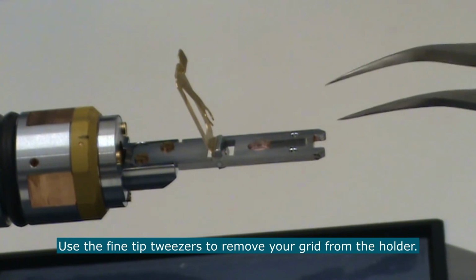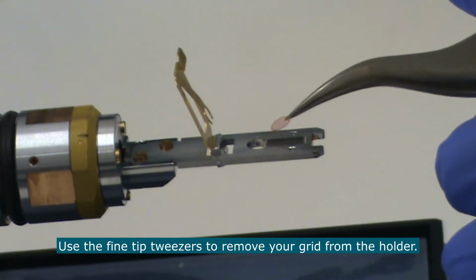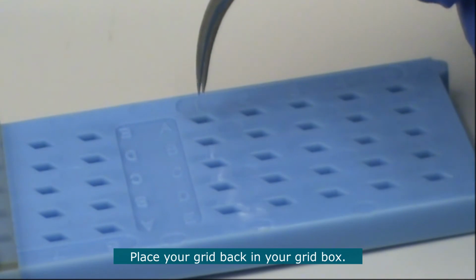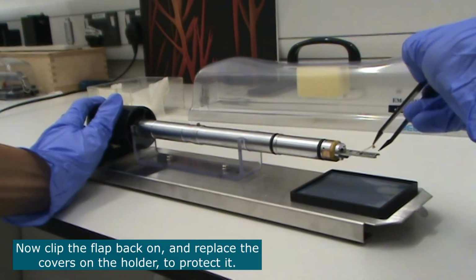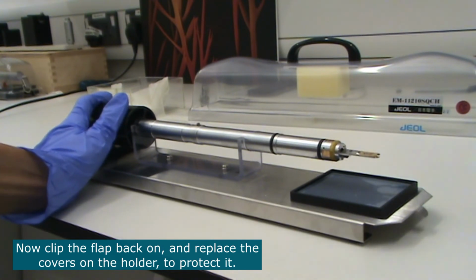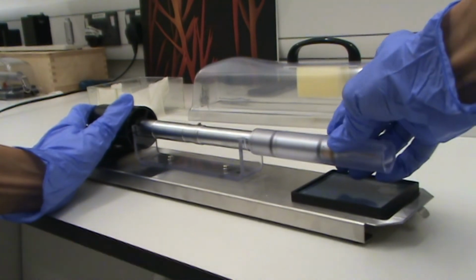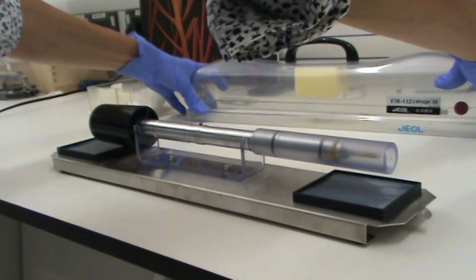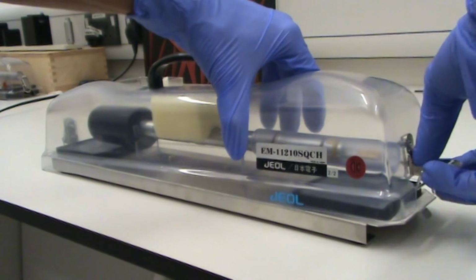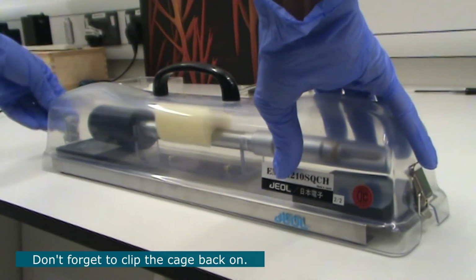Use the fine tip tweezers to remove your grid from the holder and place it back in your grid box. Now clip the flap back on and put the covers back on the holder to protect it. Don't forget to clip the cage back on.